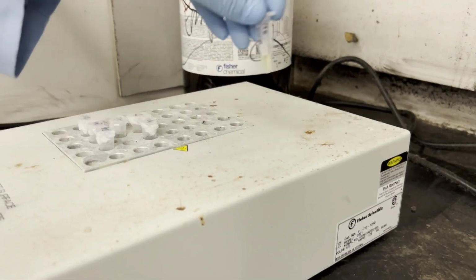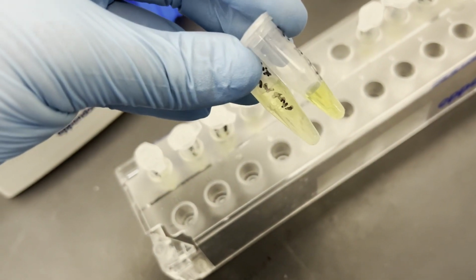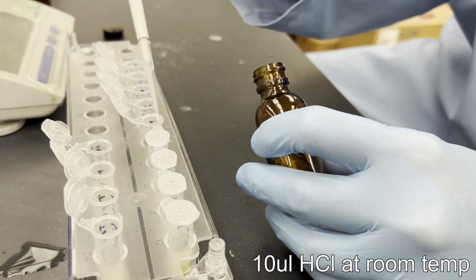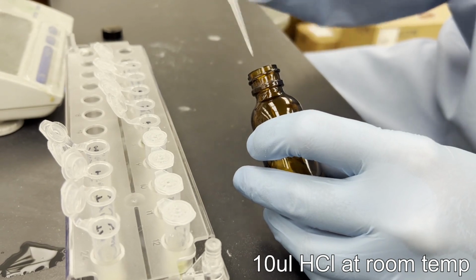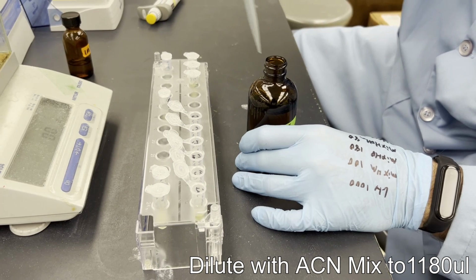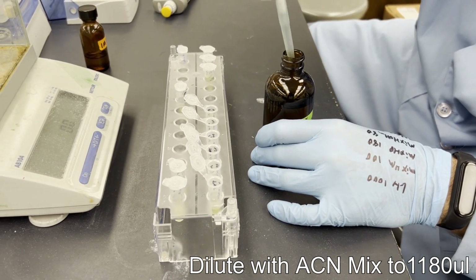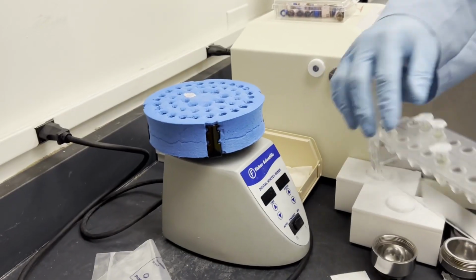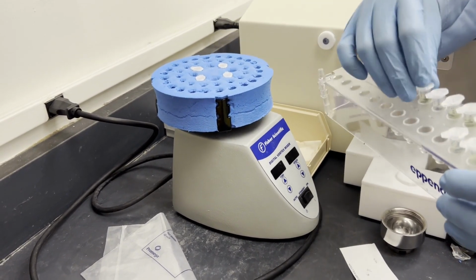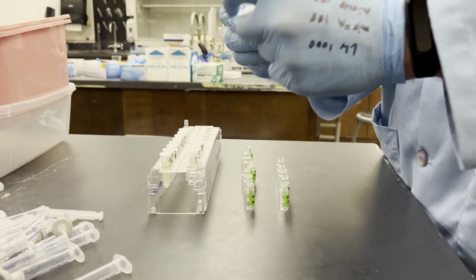With our samples done derivatizing, we are left with pale yellow samples, or deeper yellow depending on concentration and which analyte it is. Allow the samples to reach room temperature, then we can quench the samples with our hydrochloric acid and dilute to the same volume using our acetonitrile solution. We'll need to make sure to mix our vials thoroughly once again. We can now add them to our HPLC vials.